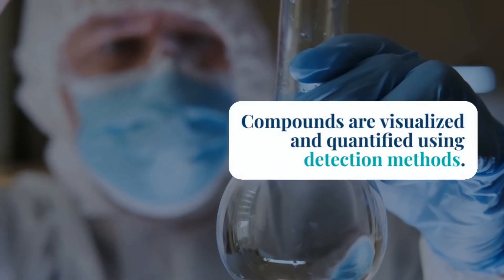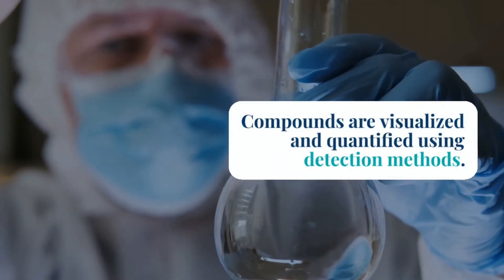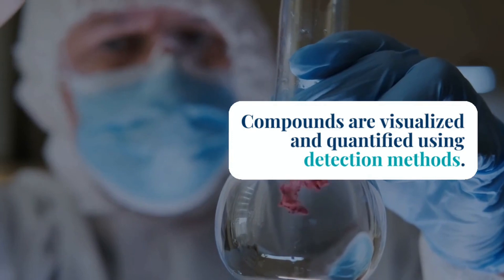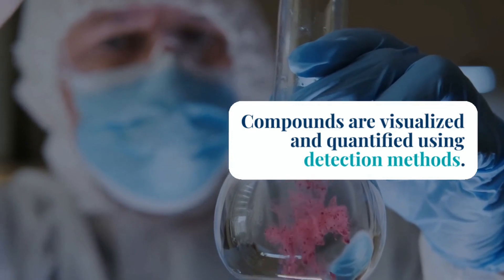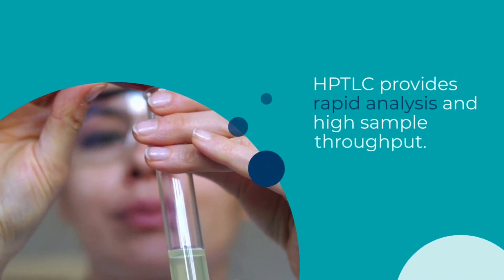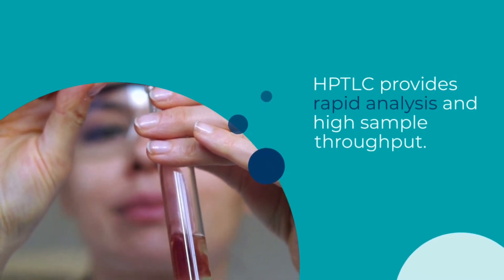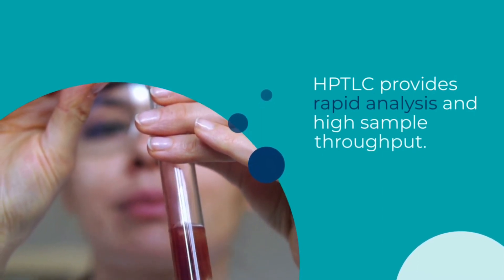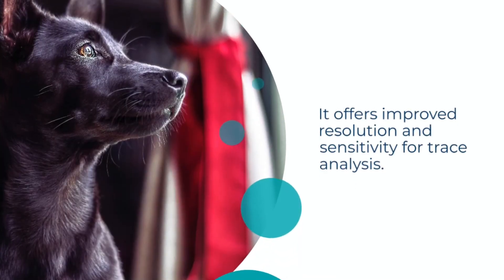2. Sample Application: A small quantity of the sample mixture is applied as a spot or band near the bottom of the TLC plate using a capillary tube, syringe, or automatic sampler. The sample is typically dissolved in a suitable solvent or directly spotted onto the plate.